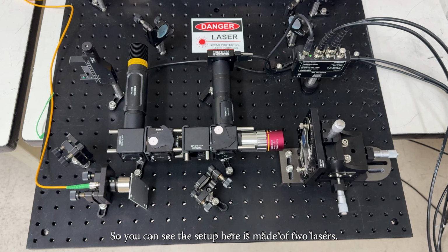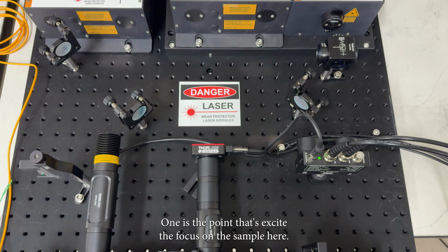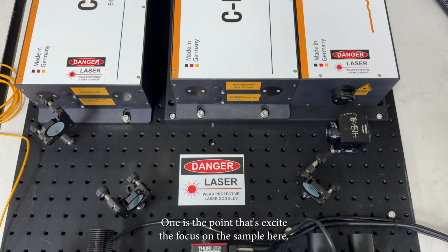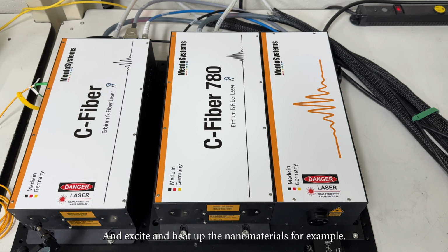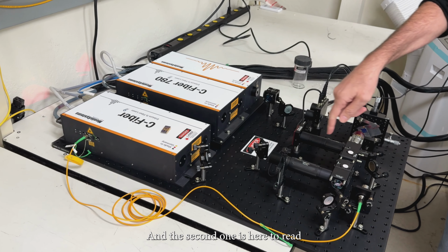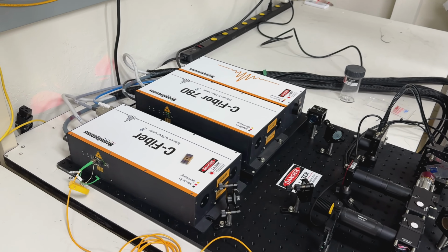So you can see the setup here is made of two lasers. One is the pump that focuses on the sample here and excites and heats up the nanomaterials, for example. And the second one is here to read the temperature that has been induced by the pump laser.